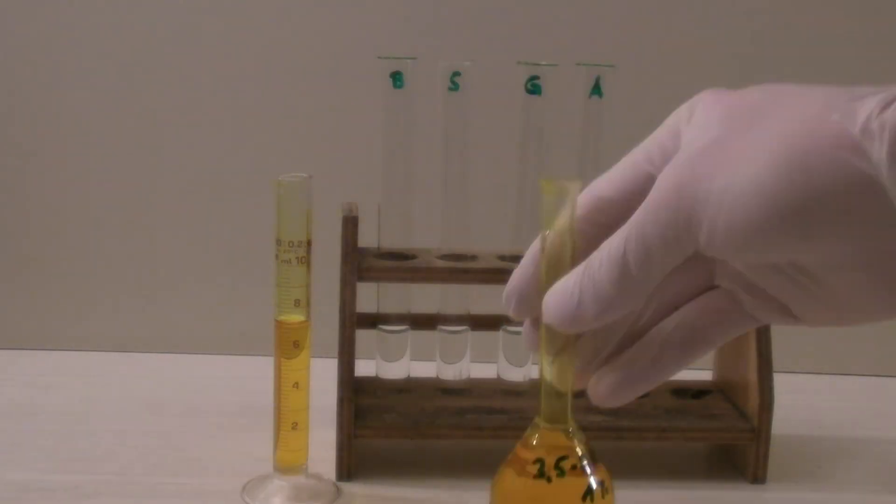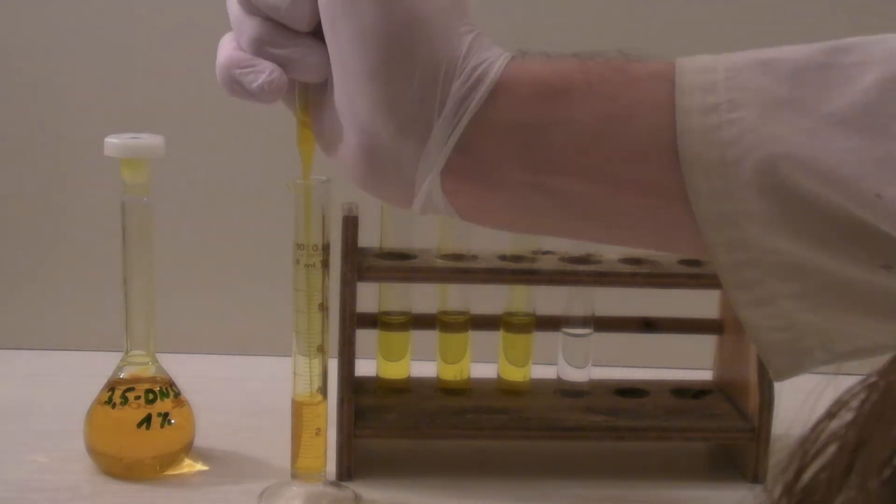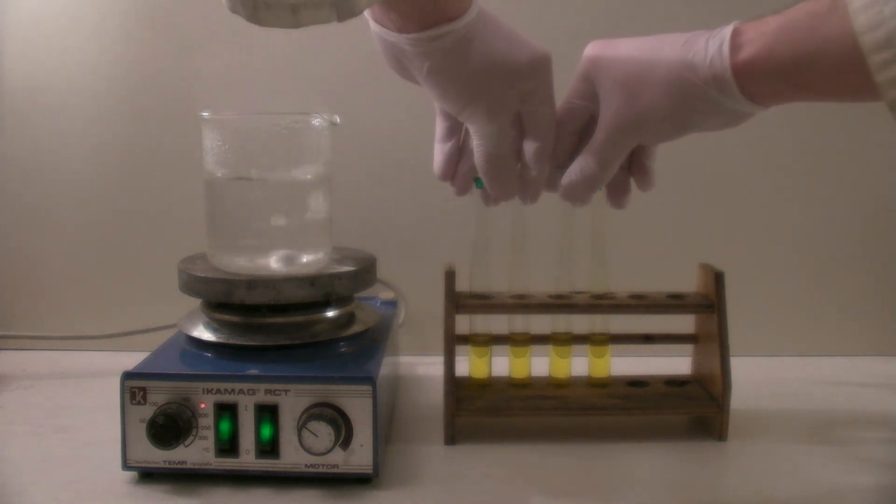To each sample, 1 milliliter of the 1% DNS reagent was added and the solutions mixed well. After that, all samples were heated for 5 minutes in a boiling water bath.